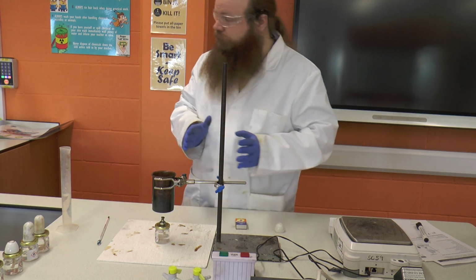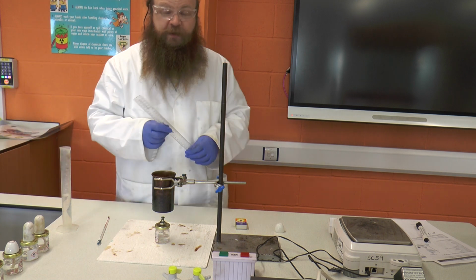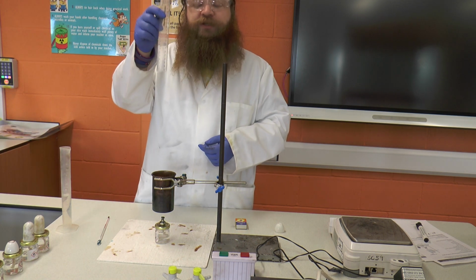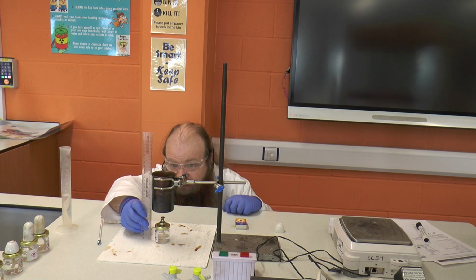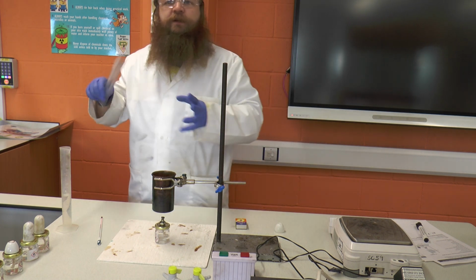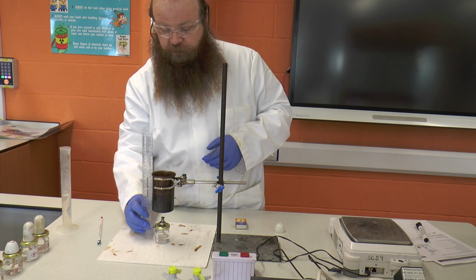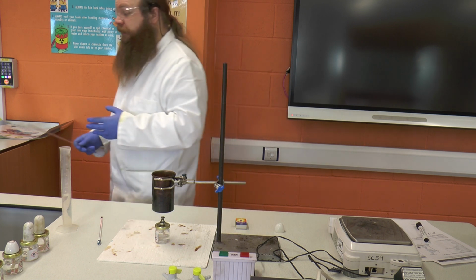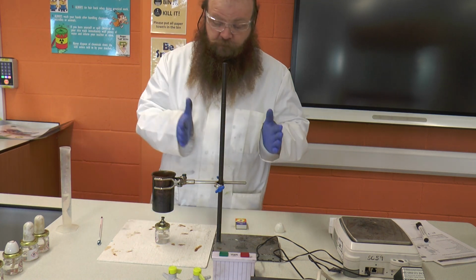To make sure that we're keeping everything the same so that we're controlling our variables, we're going to measure and record what that height is. In this case I've done 10 centimetres, and then for every subsequent time I can make sure that the bottom of the can is 10 centimetres away from the surface, keeping that factor the same throughout.